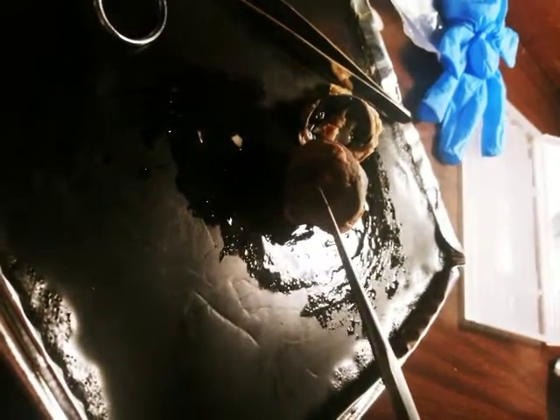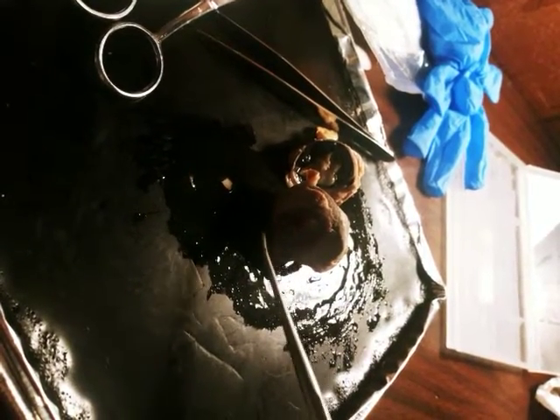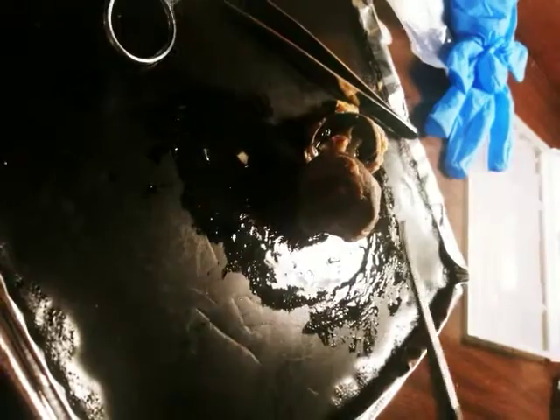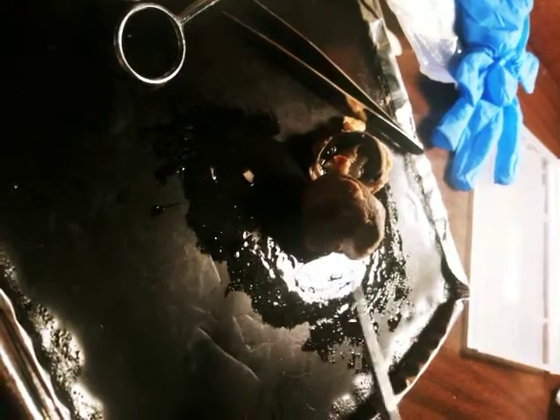Let's see here. The front of the eyeball. Oh goodness. Okay. I think this lamp can kind of help you see through the areas here. At least give it a little background, because I couldn't get that film layer off the pupil. But in the middle is the pupil. Around the pupil, behind the pupil, well, you can't see it behind, but is the iris. The cornea is, of course, the big layer of film that goes over the eye, or over the pupil.